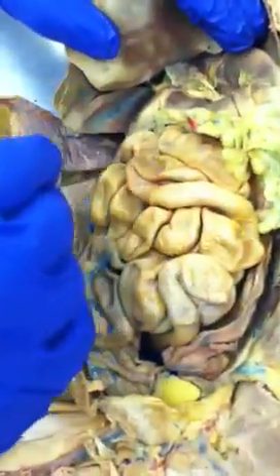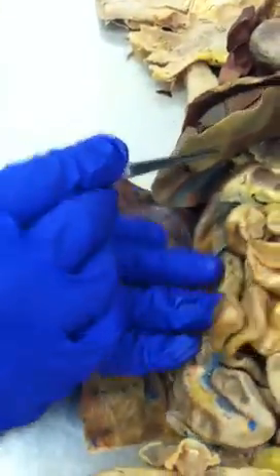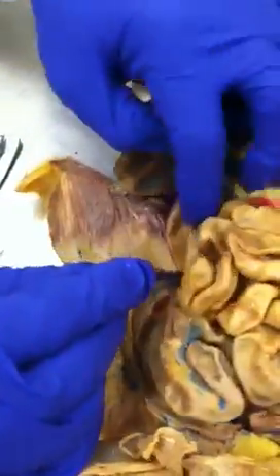The small intestine goes down here, and you will see running alongside it the pancreas. You see it? I don't know if you can see it properly, but pretty much this is the pancreas. It goes all the way here, and it also juts across over there, and you'll see all sorts of pancreas over here on this other side.